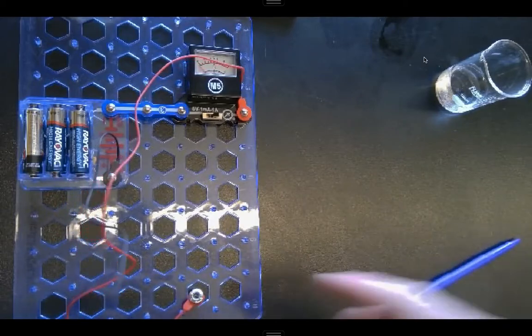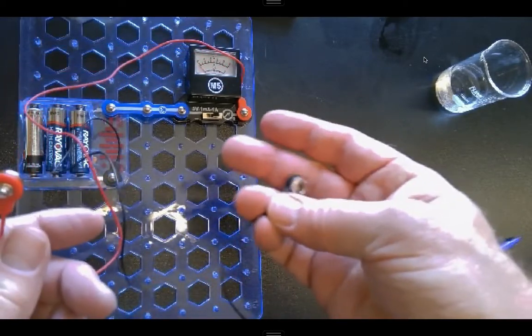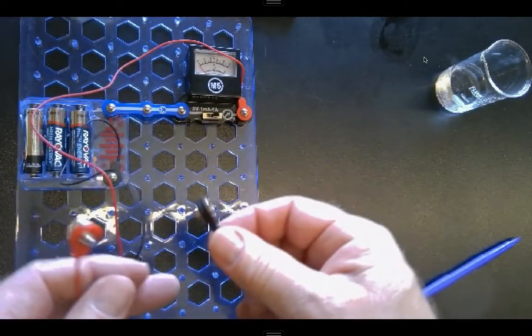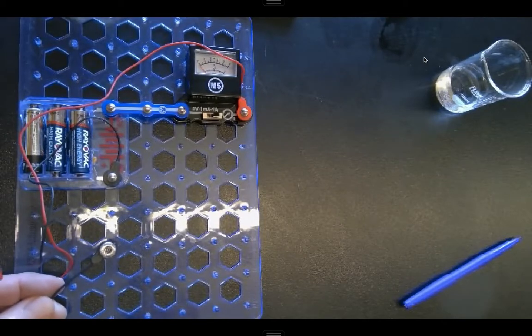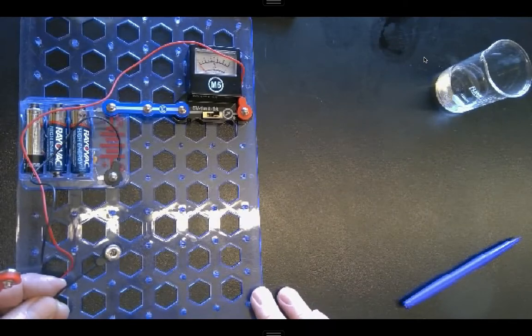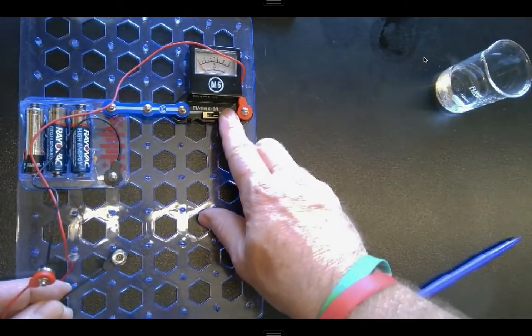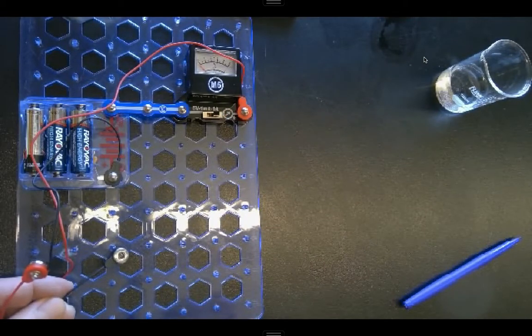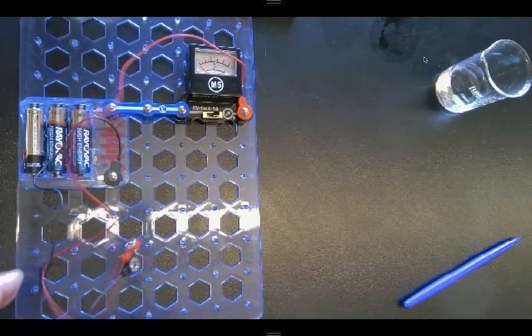And then I've got a couple of electrical probes and wires that I can set up on either side of things, and I can measure my conductivity of some different materials. All right, and it tells me in the directions to set it to the 1 amp setting, which I currently have. Okay, and if nothing shows up from that, then I need to adjust to go to the milliamp setting.